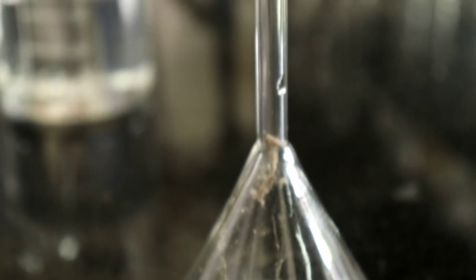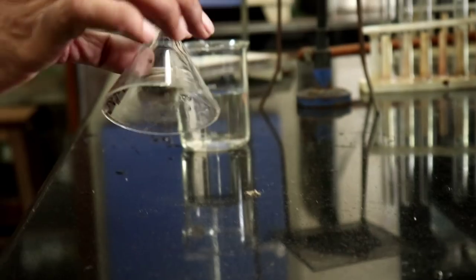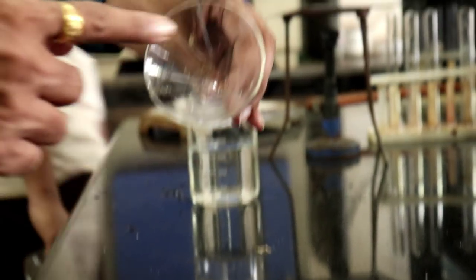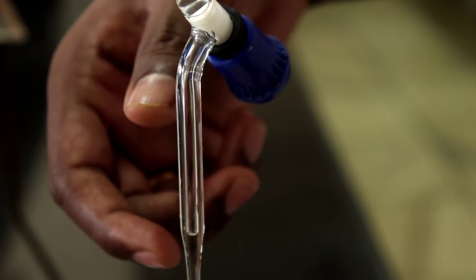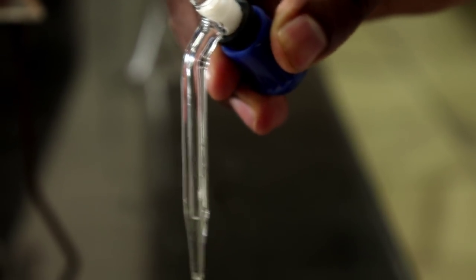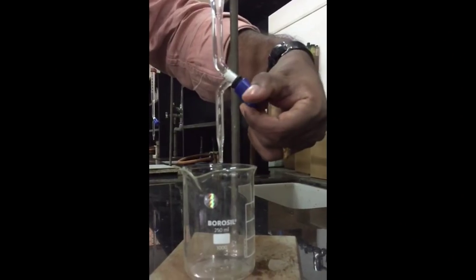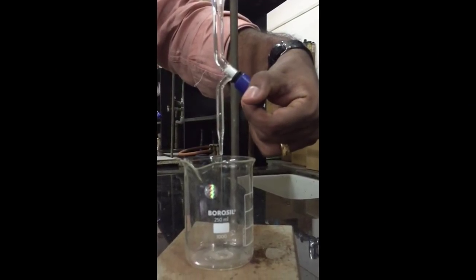The reason being after using the funnel you might keep it down and allow foreign particles to enter your solution in the next filling. This part of the burette has an air gap and we need to remove it. So release the solution in full flow and the air gap will be removed.